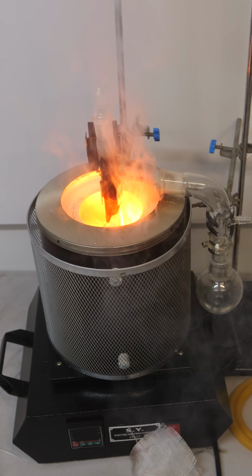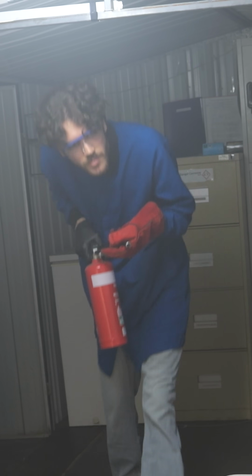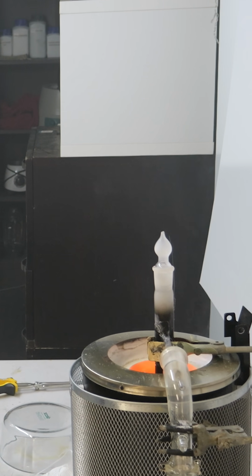Metal fires are almost impossible to put out. I can't use water as it might explode. Breaking the glass will give it more oxygen, and I can't use this fire extinguisher because I didn't want to. My best option is covering it in potassium chloride from earlier, but since this fire was contained, I decided not to waste my chlorides and instead waited for it to go out.